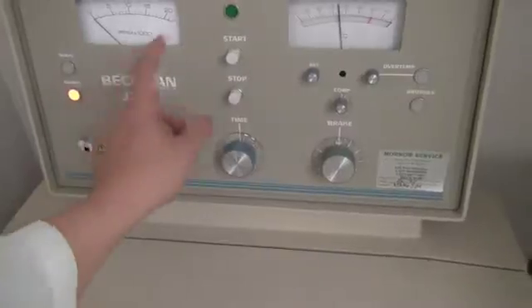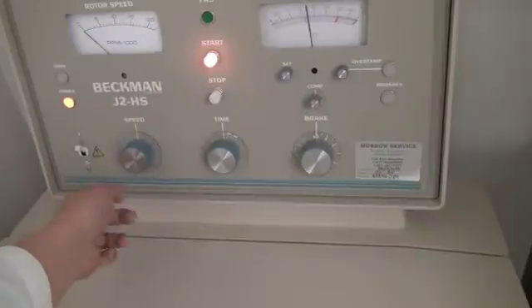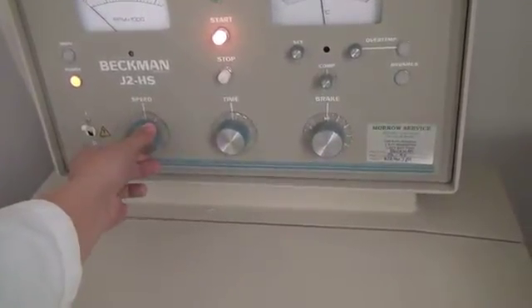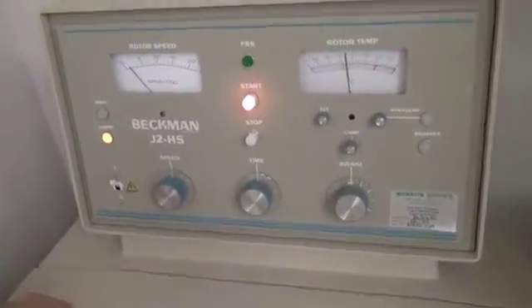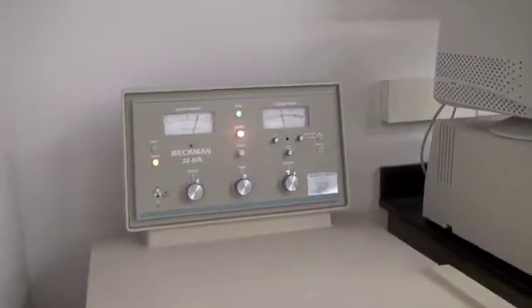Master TA will not allow any of the researchers to operate the centrifuge to avoid any misuse. In fact, he is careful in accelerating the spin by increasing the speeds by 2,000 RPMs at a time. He listens and watches the centrifuge to ensure that the rotor is spinning in a balanced fashion. An unbalanced rotor will cause the centrifuge to shake and make knocking noises. It's a lot like a clothes washer shutting down during a spin cycle.